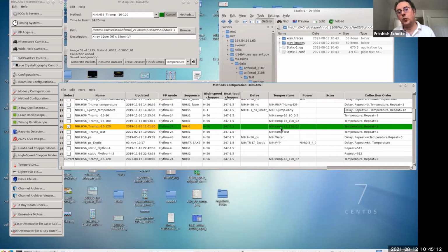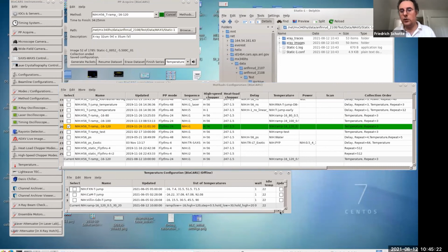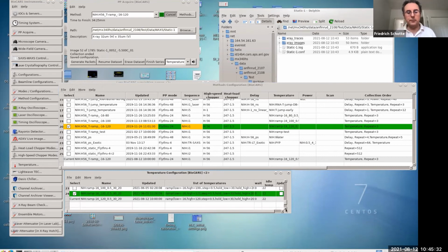And here's the temperature range, which is a linked subtable you can inspect. The only variable in this scan is temperature, nothing else going on. So you see from -16 to 120 in steps of 0.5. And then at the beginning it holds the temperature for 30 images. Let me enter the next destination directory. So that is the temperature range.